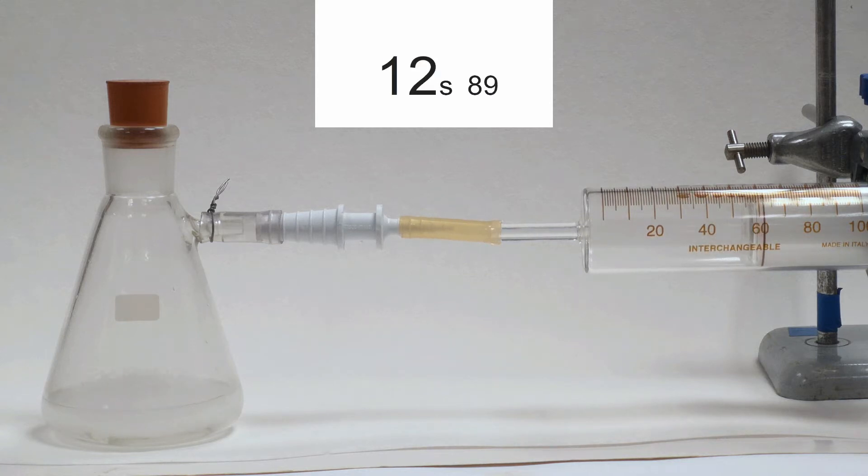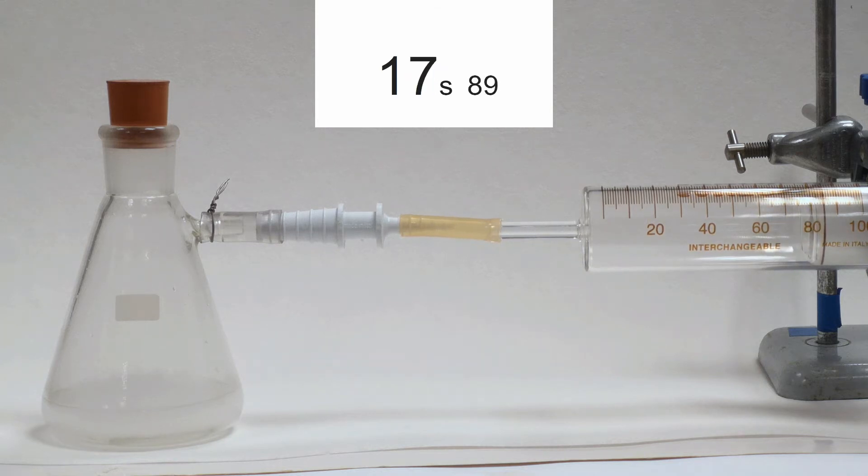As you can see, once the bung is in, the hydrogen gas begins to push the plunger of the syringe outwards at a steady rate.